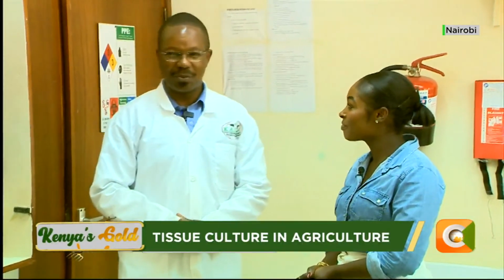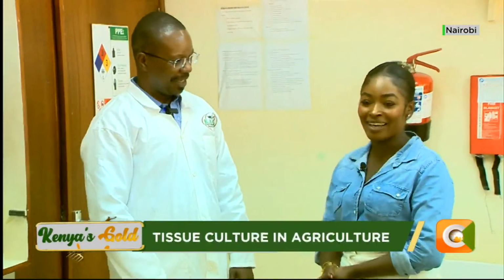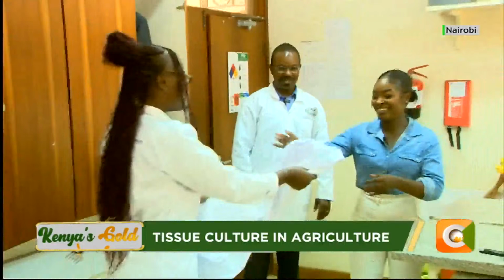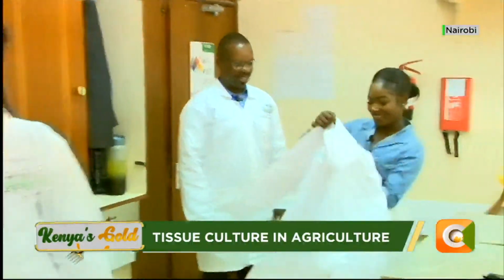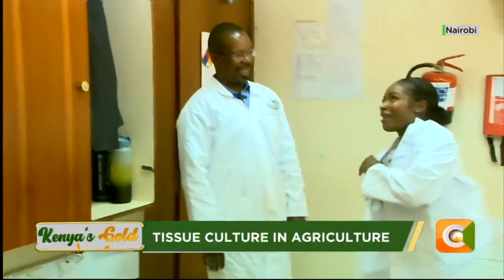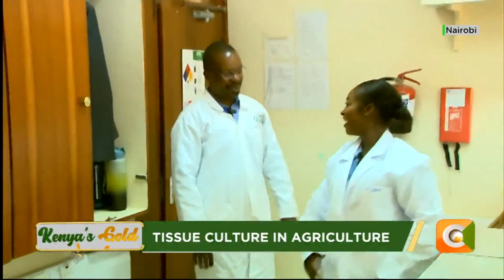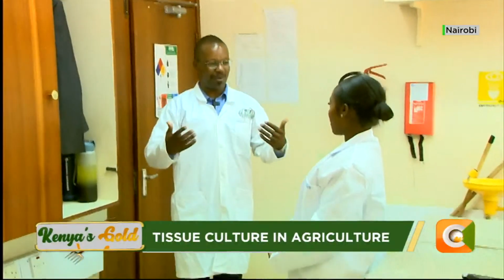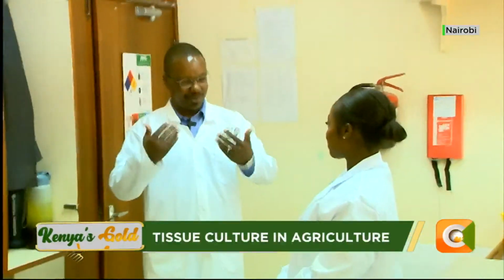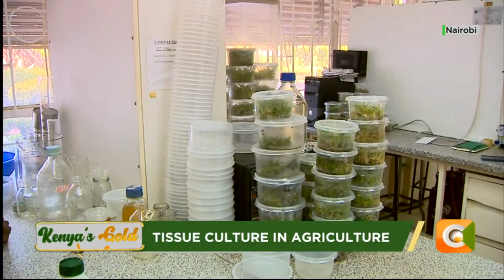Thank you. But before we proceed, probably you need to put on the attire. Now we are inside the lab. You also need to be protective. Thank you. So this is what we call the lab coat. Now I feel like such a scientist. Yes. It helps you not to get anything from the lab, and also not to bring in anything. So that's how we operate from here. Right. So my name is Dr. Martin.